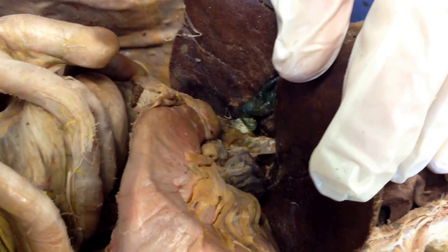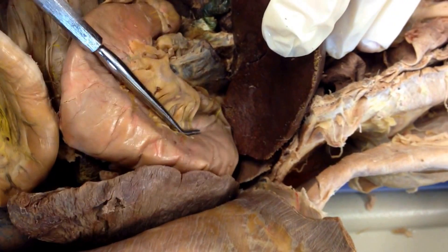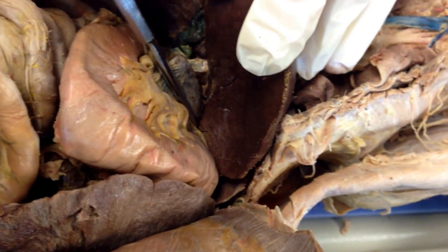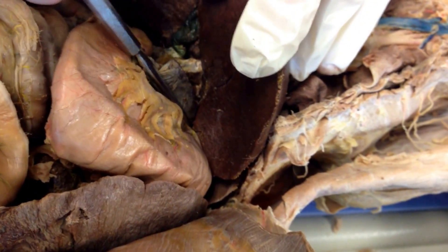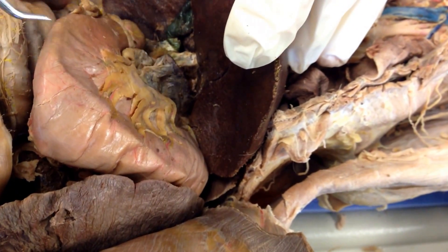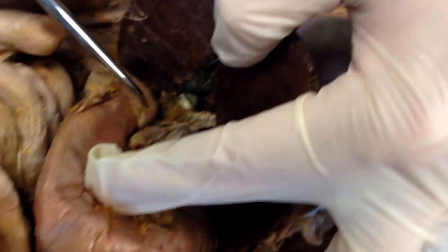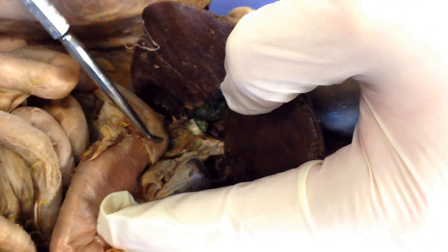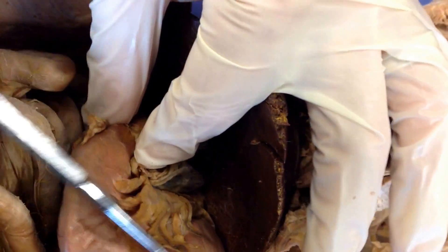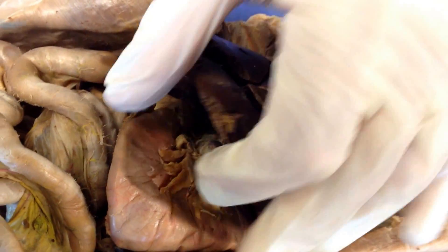Next on your list is the stomach. Here's the stomach going around this way. The stomach has two sphincters. At the top part, way up here underneath the liver, is the lower esophageal sphincter that prevents acid reflux and prevents stuff from going back in the other direction. On this end is the pyloric sphincter between the stomach and the small intestine — it's just muscle that prevents food from leaving until we're done crushing it up in the stomach.